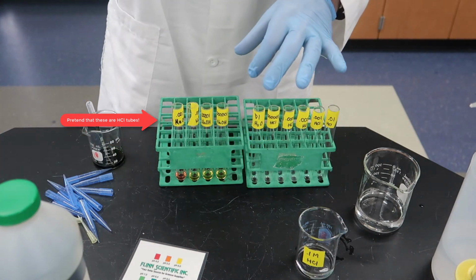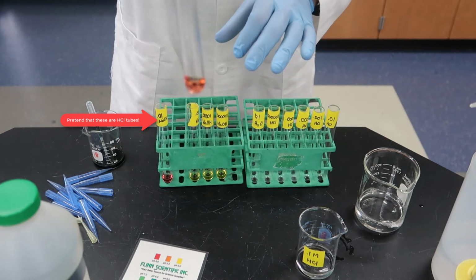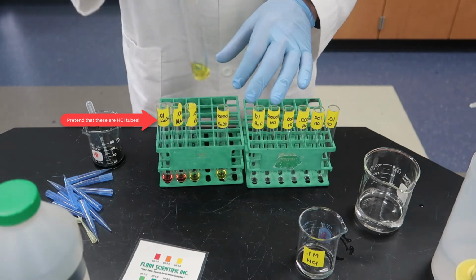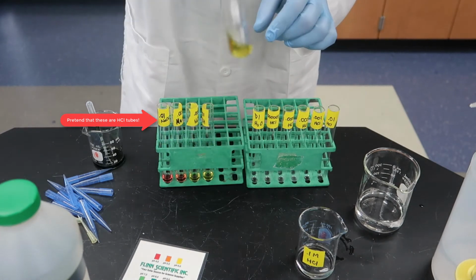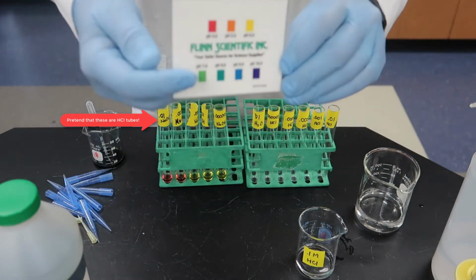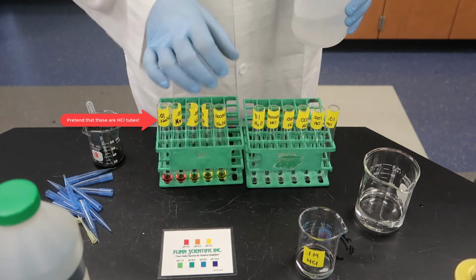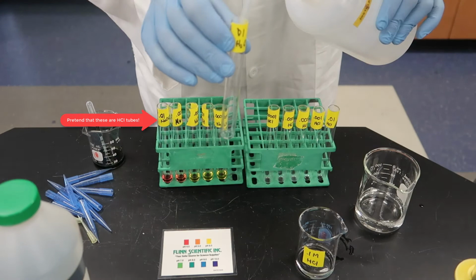Okay, so mix those up. You can see that one's pretty much a bright reddish pink. That one's a little lighter pink, maybe a little bit more of an orange hue. And that one looks pretty yellow. That one's also yellow, maybe a little darker. And a little bit darker yellow, maybe starting to look a little green. This is what the pH values should look like. You can see a pH of 4 is very reddish, up to yellow being pretty close to 6.